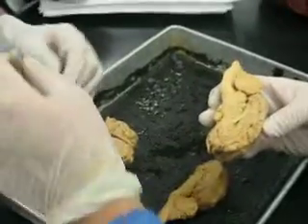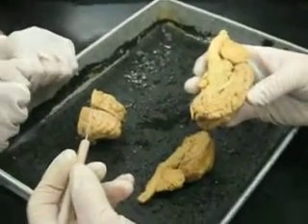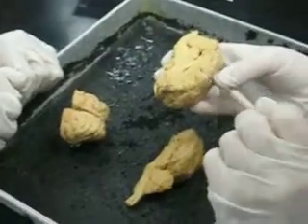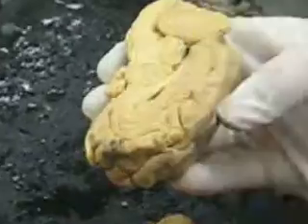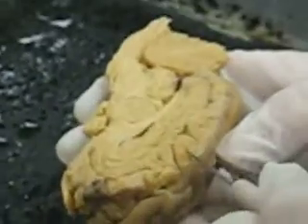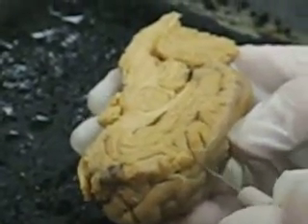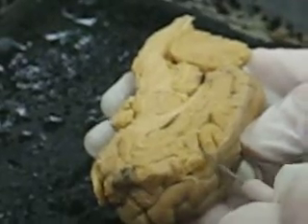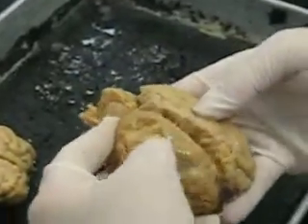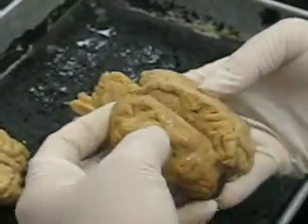Alright, so we have, kind of going in order. Gyri are the bumps, these little bumps that go up and down. The sulcus would be this groove in here. Okay, those are the grooves. That's the sulcus, singular. Longitudinal cerebral fissure is just where your brains are connected. So if you pull them apart, there's a fissure, a cut.